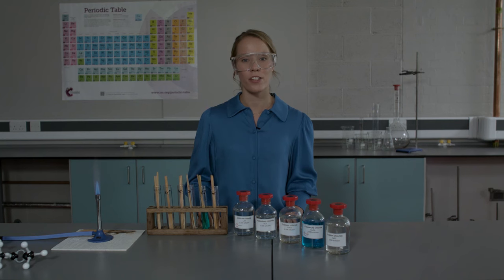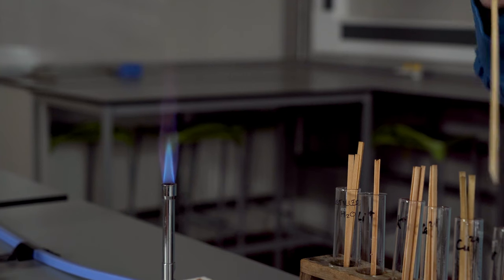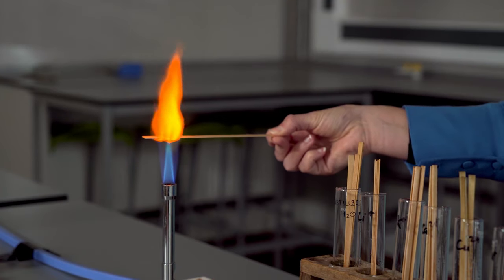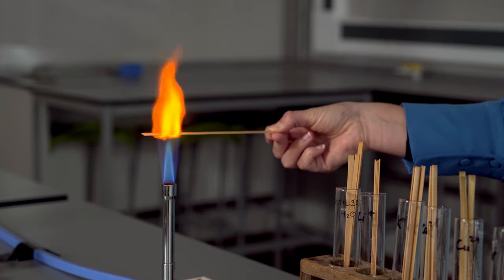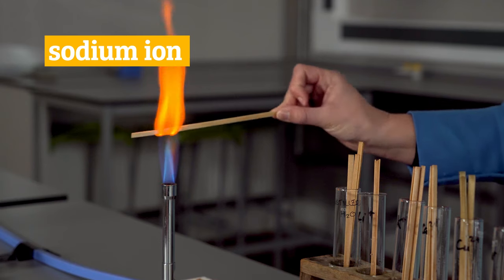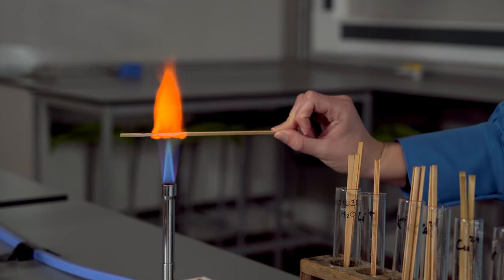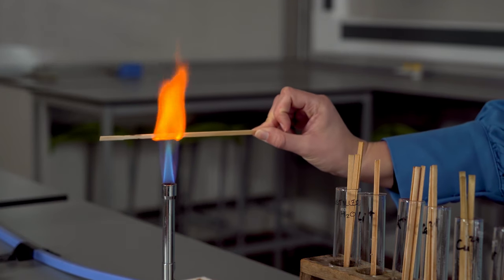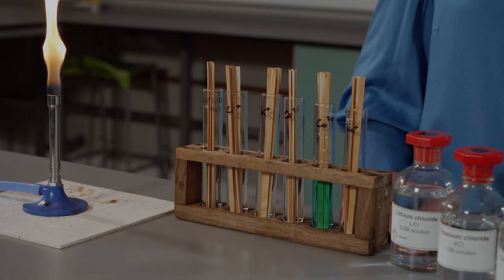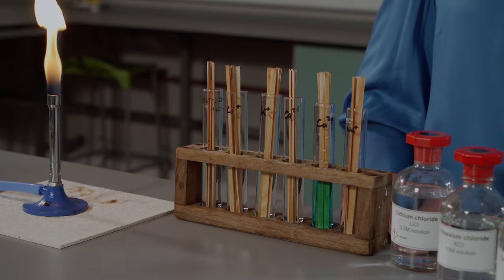Finally, I will test the sodium ions. You can see a very bright yellow-orange flame. Let's look at those flame colors one more time.